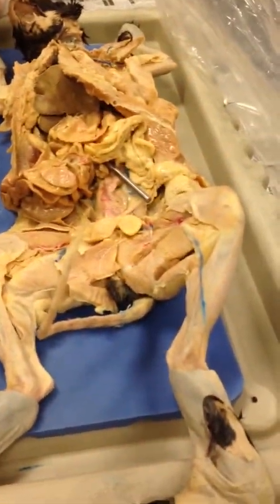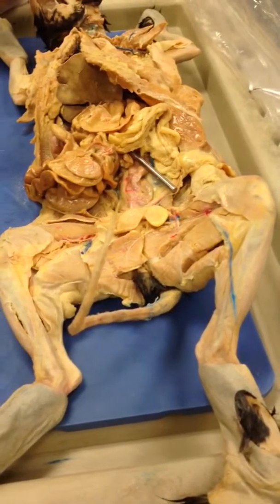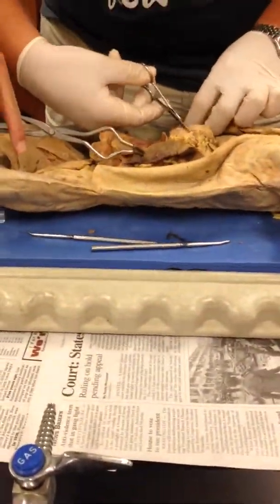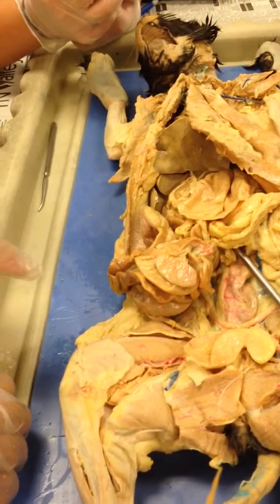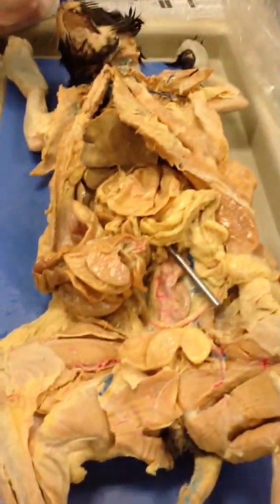So the spleen, would that be? That's the spleen right there. Okay. So right there is the spleen. If you ladies are having difficulty, you could come over here, Cameron, and look, or I'll be over there in a minute. Are y'all through with me over here?